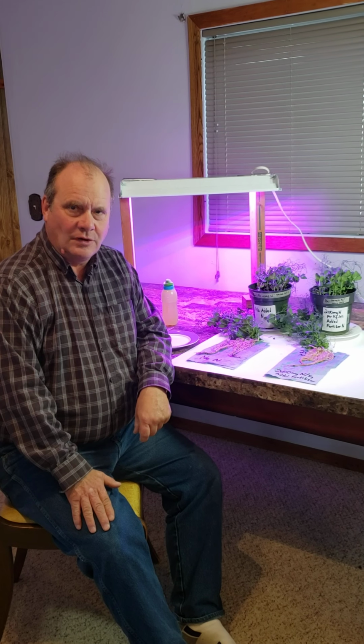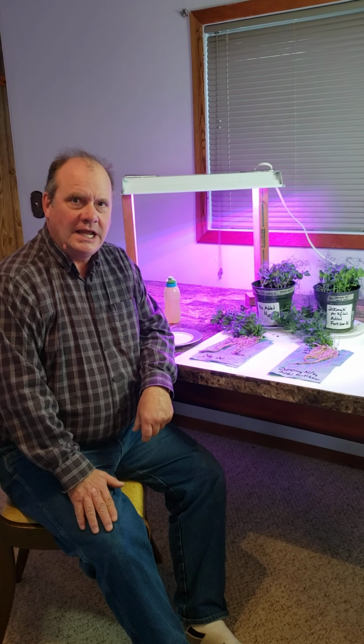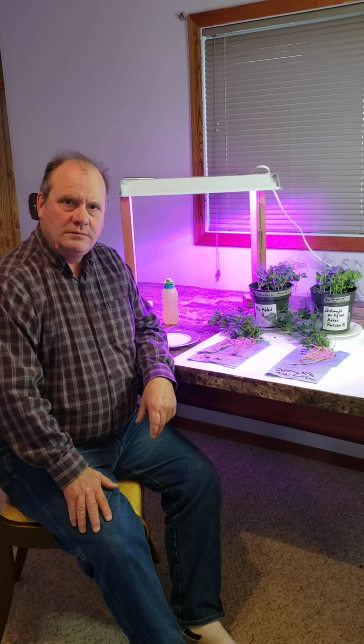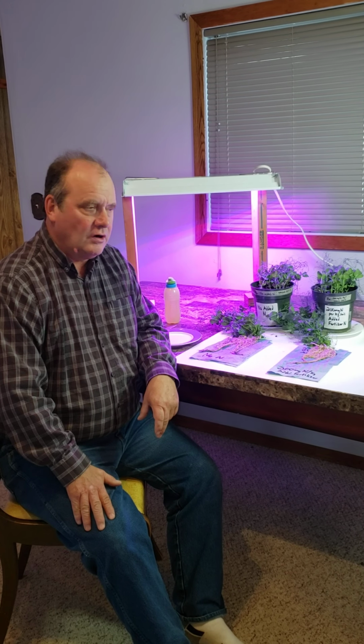Welcome folks to this demonstration of the effect of large amounts of available nitrogen in the soil on nodulation and nitrogen fixation in a legume plant, in this case pea. So what I've done is I've grown pea plants on a nitrogen deficient soil. Actually, it's a Bradwell sandy loam soil collected from near Saskatoon that had barley growing on it this year and is very low in available nitrogen.